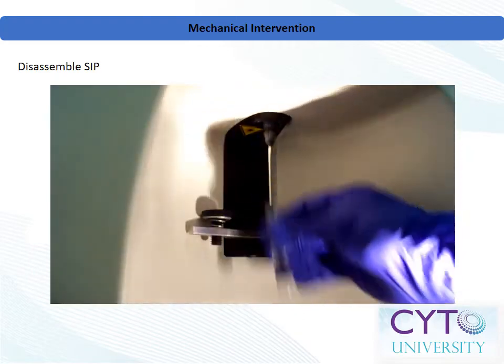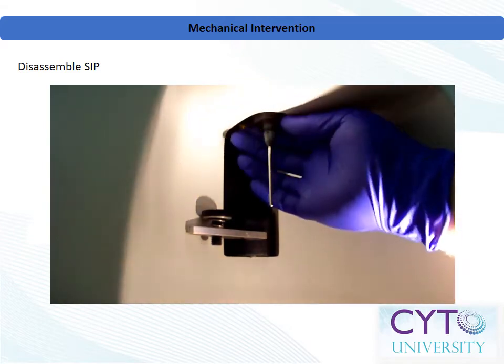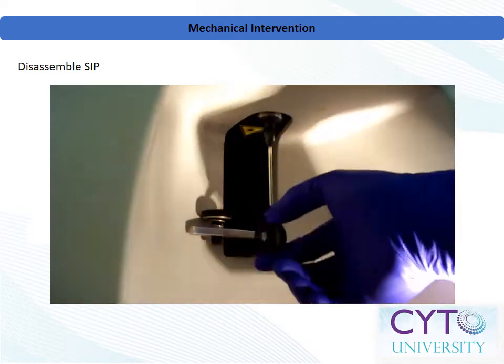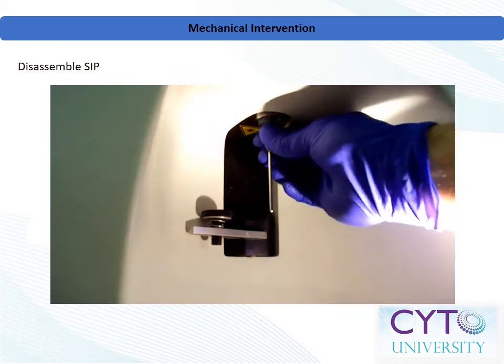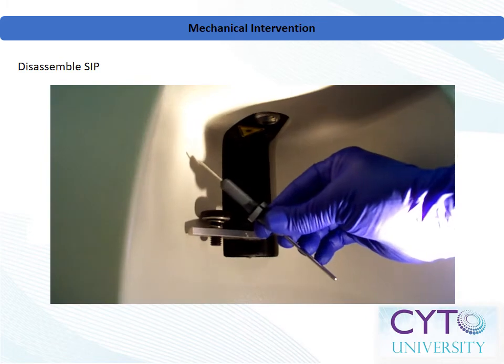In this example, we will show you how to remove and disassemble the sample injection apparatus from a commonly used analyzer. Before you begin, be sure the instrument is on standby. Unscrew the lock ring from the top of the injection port. Grip the sample injection apparatus by the cone section and firmly pull straight down. Continue pulling straight down until the metal tube is completely clear of the instrument. Note the location of the notch at the front of the sample injection apparatus, which corresponds to the tab at the entrance of the flow cell. Ensure that all O-rings remain attached.